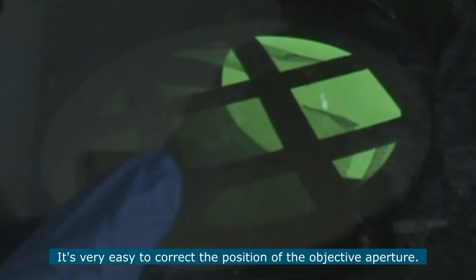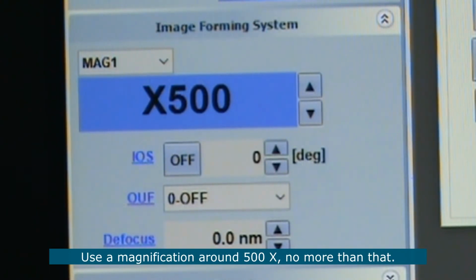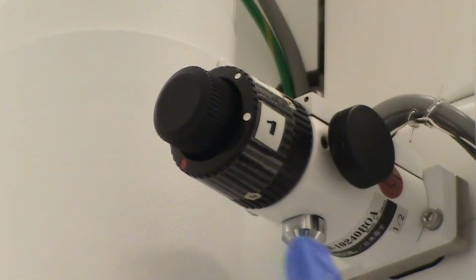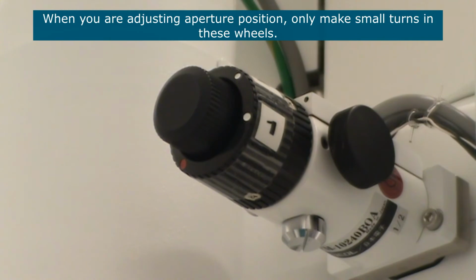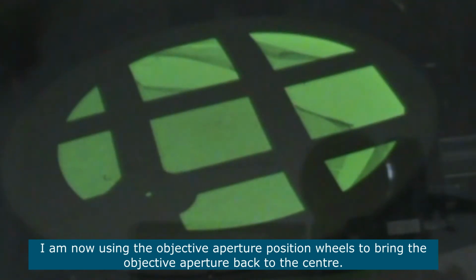It's very easy to correct the position of the objective aperture. When correcting the position of the objective aperture, you will need to use a magnification around 500, no more than that, so that you can see the edges of the objective aperture properly. These wheels here control the position of the objective aperture. Small turns in these wheels will make a big difference in the position of the aperture. So when you are adjusting aperture position, only make small turns in these wheels. I am now going to use the objective aperture position wheels to bring the objective aperture back to the center.